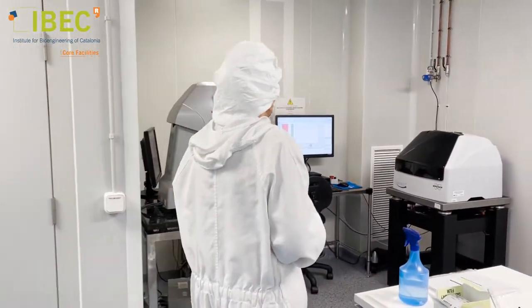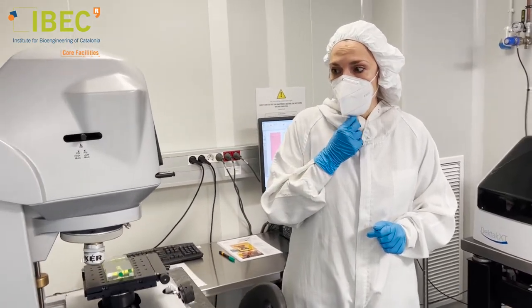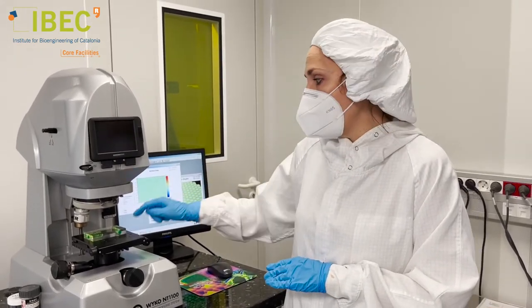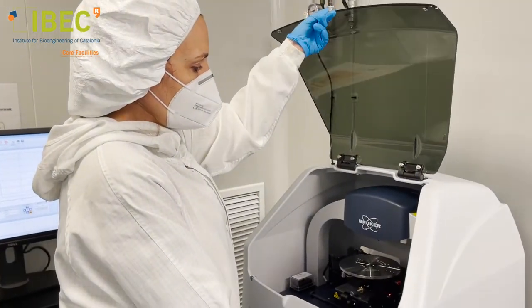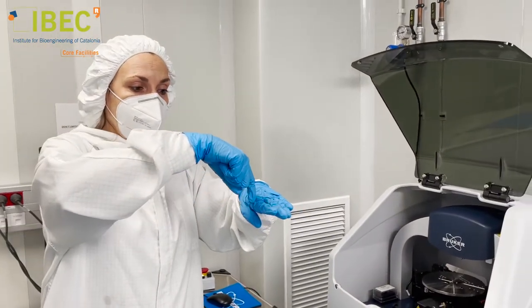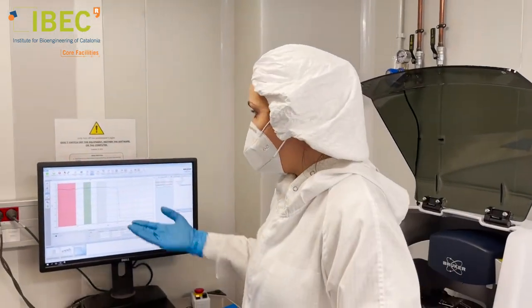In this area we have a profilometer. This is a light optical profilometer and this one is mechanical. In the optical one, we use the interference created by the light incident on our substrate and the reflected one, which creates an interference pattern that depends on the topography of our substrate. The mechanical one works by using a small needle that scans our surface and gets the profile of our structure, characterizing substrates in step height but also in lateral dimensions.